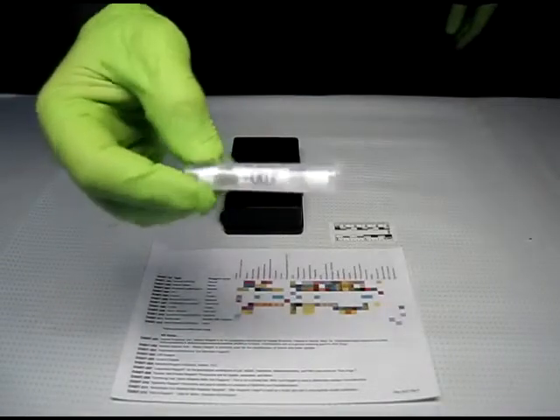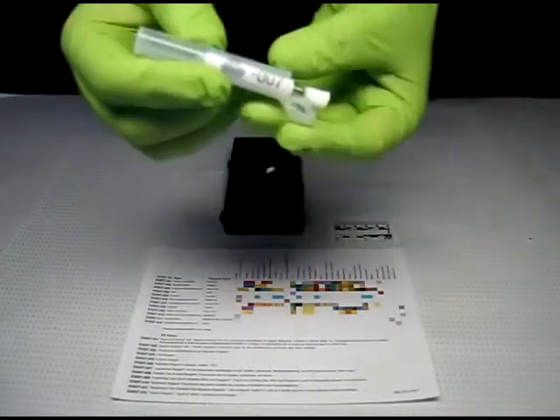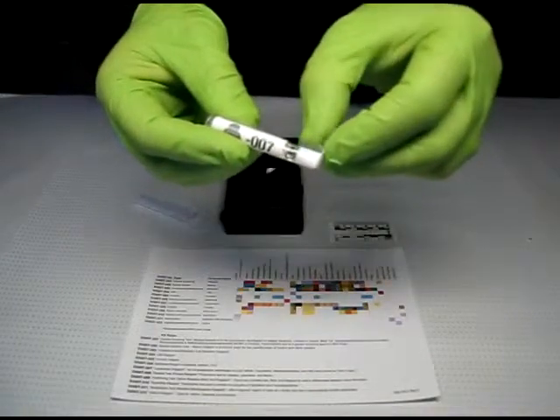Here we are demonstrating the DABIT 007 LSD MDMA oxycodone test. Remove the sampler from the clear outer tube. Remove the protective paper from the sticky sampler tip.